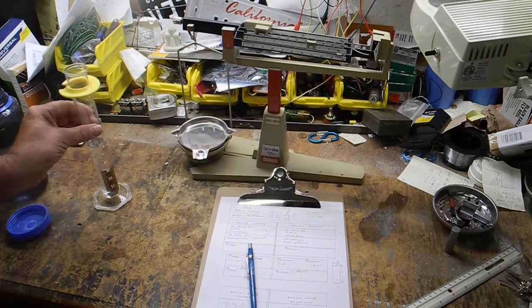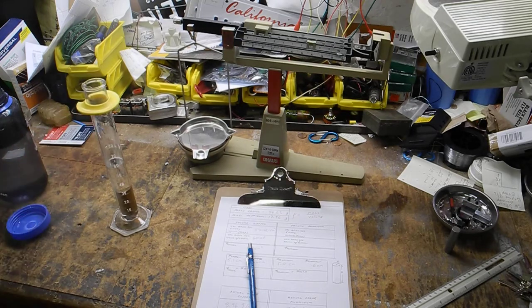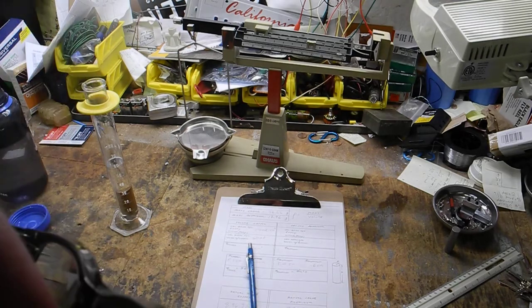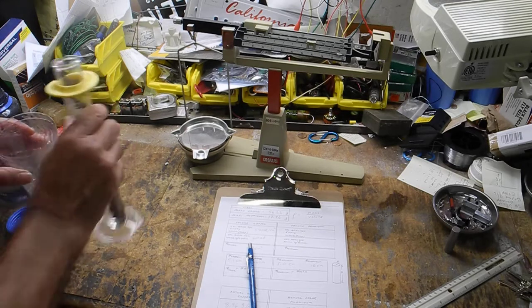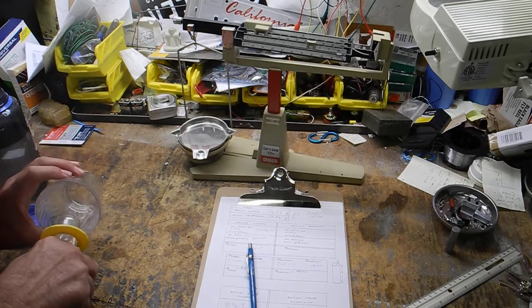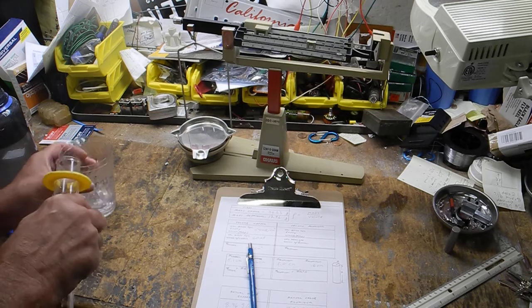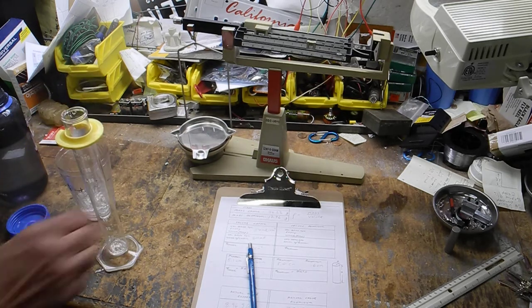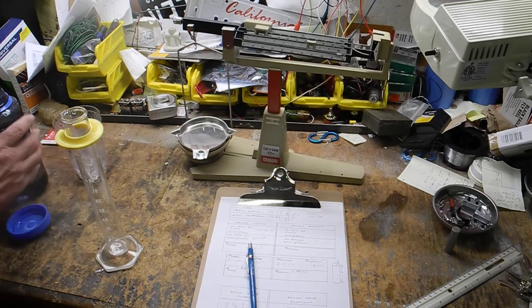So what I'm going to do is dump this water. Oh, I didn't bring a thing to dump it out. Yeah, I did. I got one of my son's experiments right here. He's been working with acrylic, doing various things. So I'm going to dump that out into this used glass. We'll take out the copper. Okay, see now the copper's wet. So we wouldn't want to weigh it. That's why I weighed it first. We'll just let it dry over there. Okay, we'll start over. We'll put some water in here and do aluminum.